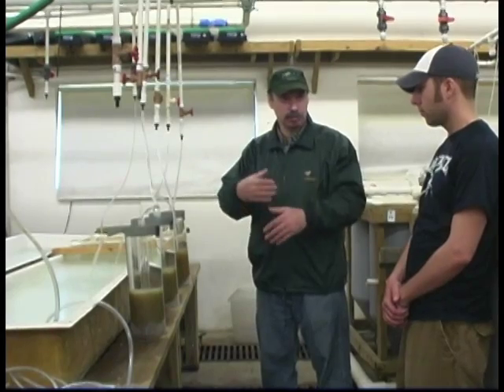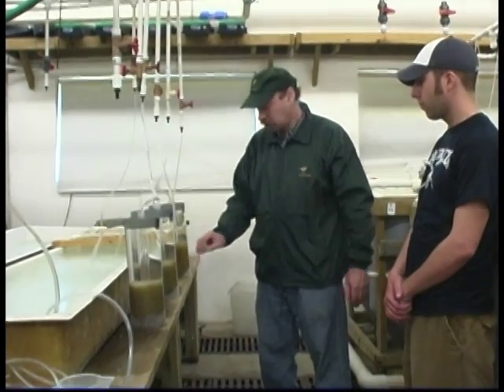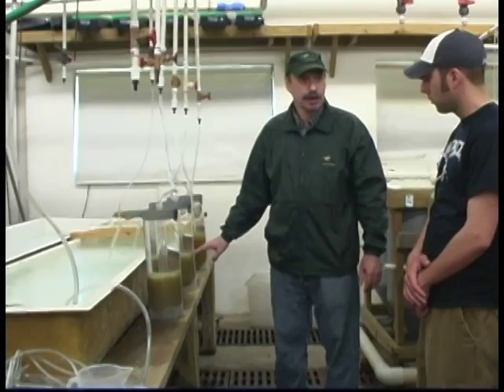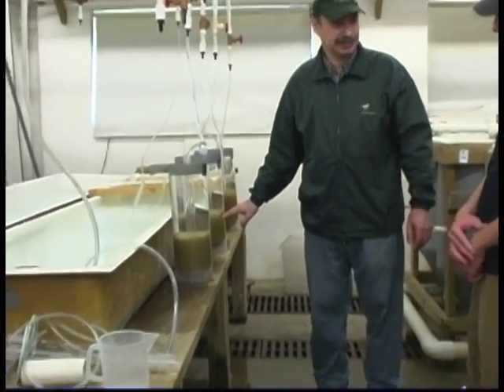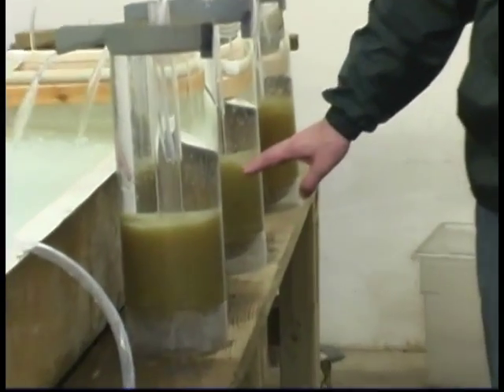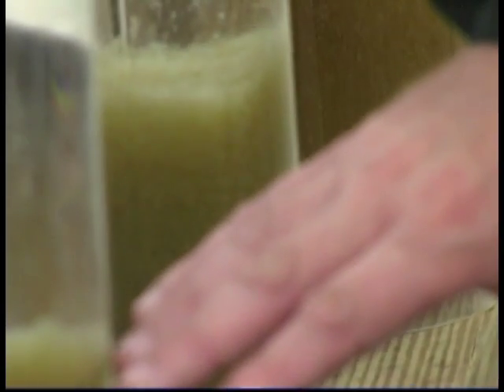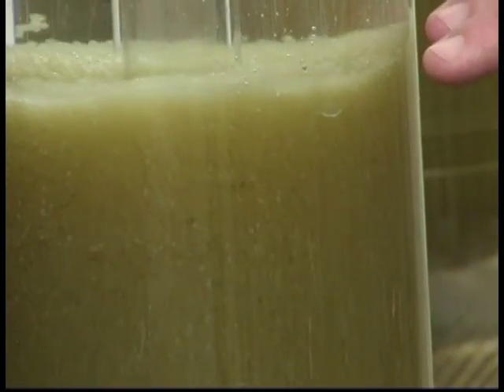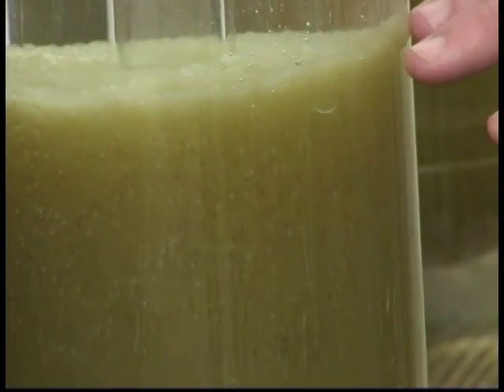You can see the eggs slowly moving. Also, you can see now that part of the eggs are white. It was hard to determine exactly, hard to count at first. But we saw that here was the most of the eggs — only a fraction was not fertilized.